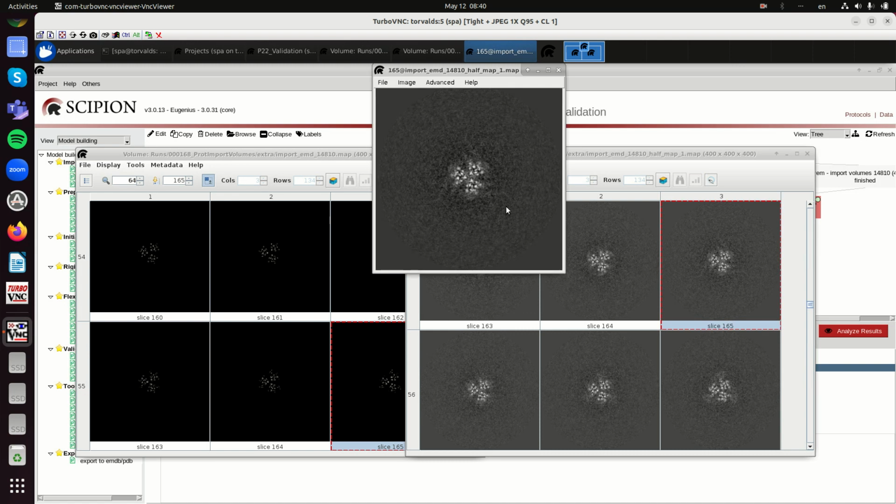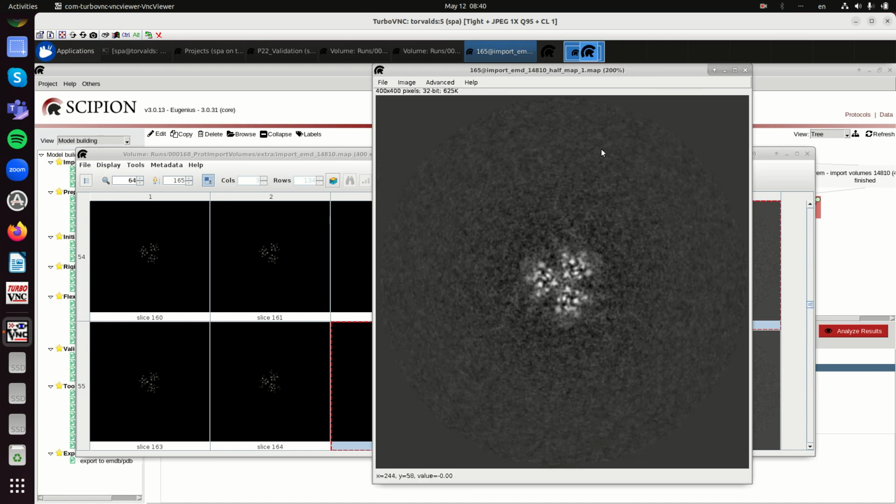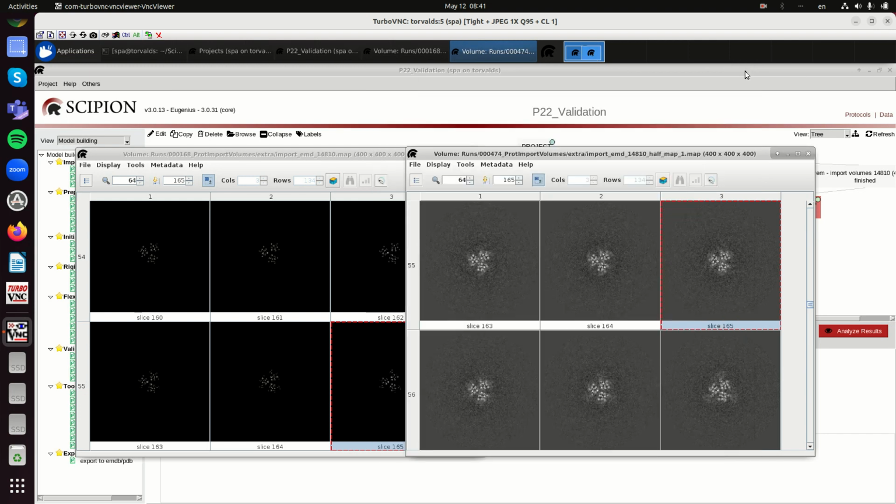So yeah, you see a lot of details, but having the noise around will help you to check what is really the resolution of your structure, at least in terms of signal to noise ratio. That doesn't mean that it is a true biological meaning. So when we say I have reached 3 angstroms resolution, what you have is a signal to noise ratio of 3 angstroms, but that doesn't mean that the signal you have reconstructed really represents a macromolecule. So part of the analysis we will do with these halves, whether they look like what they should.